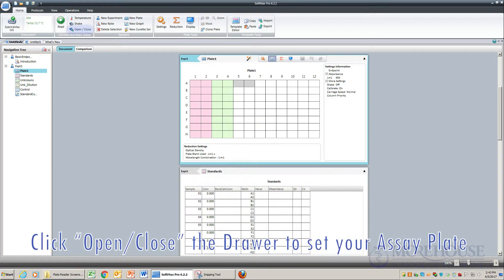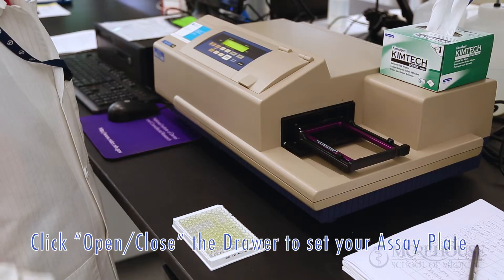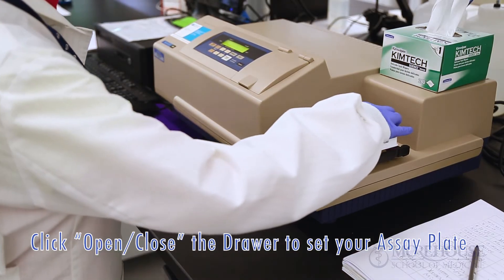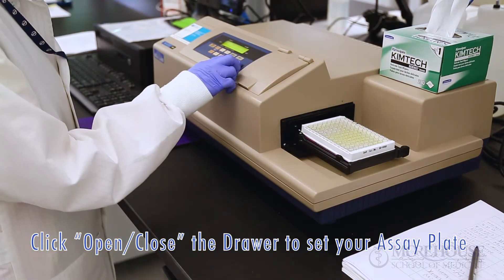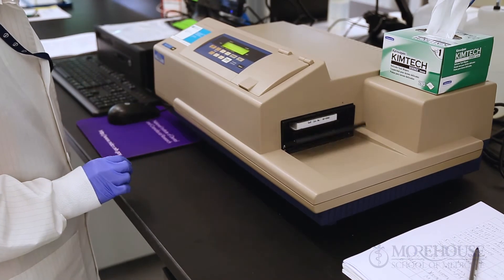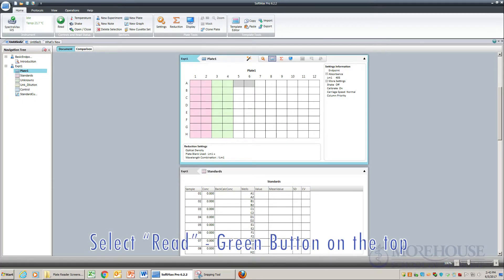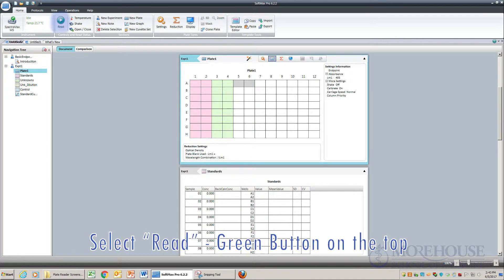Click Open/Close the drawer to set your assay plate in. Then select the Read green button on the top.